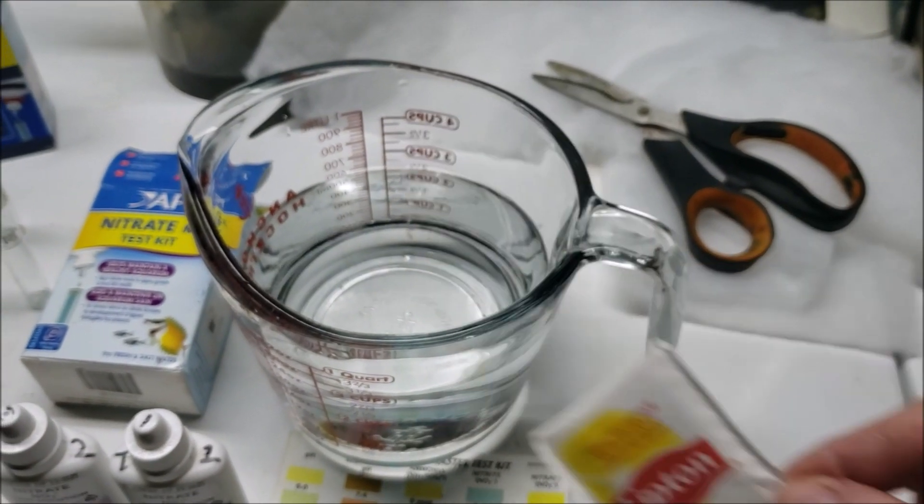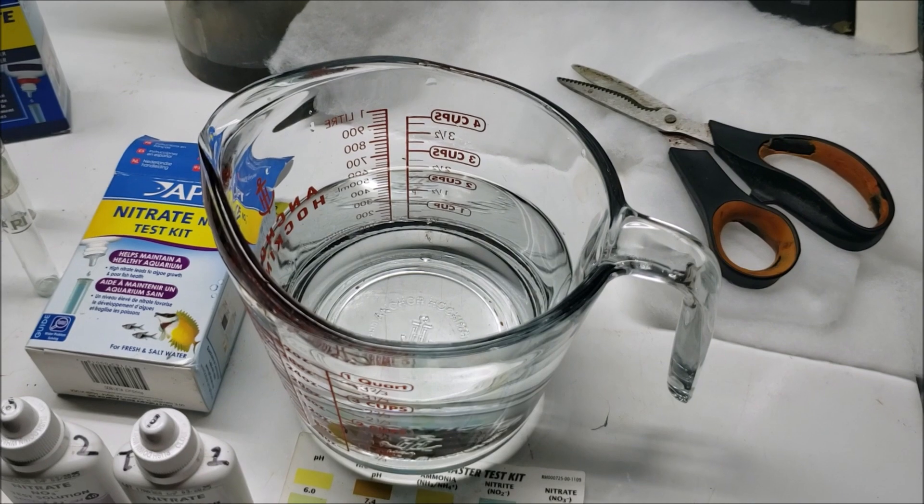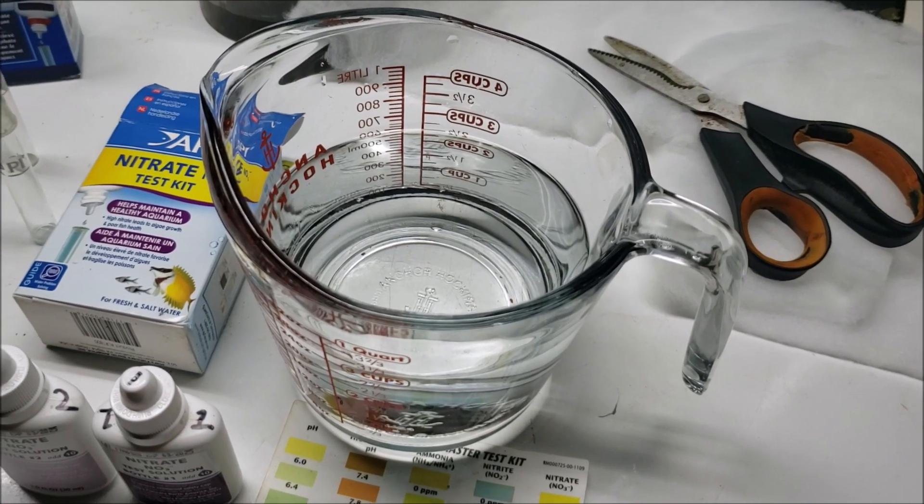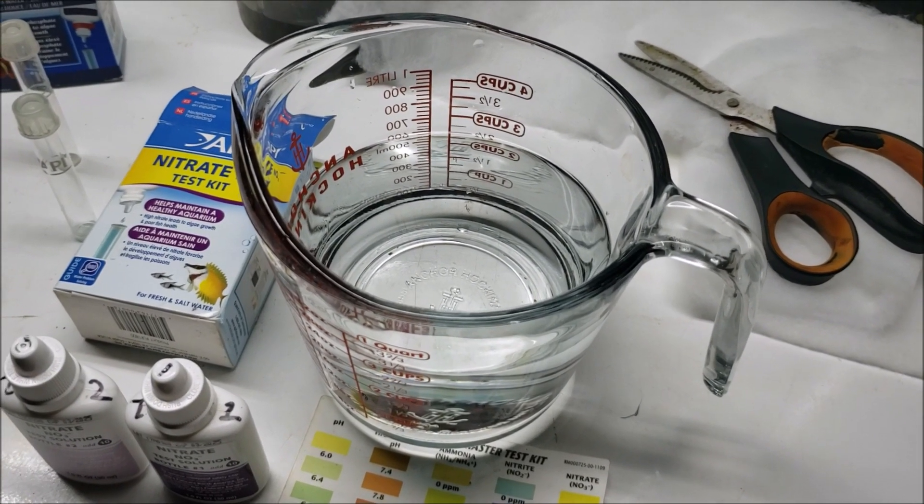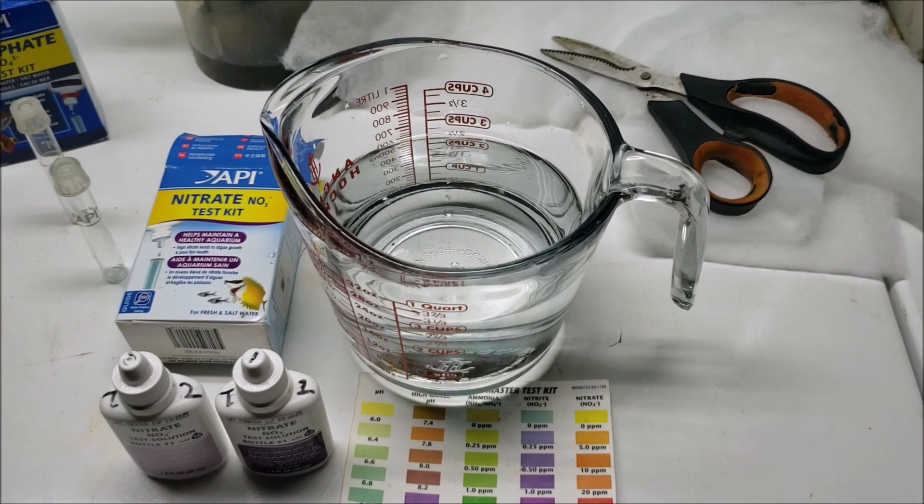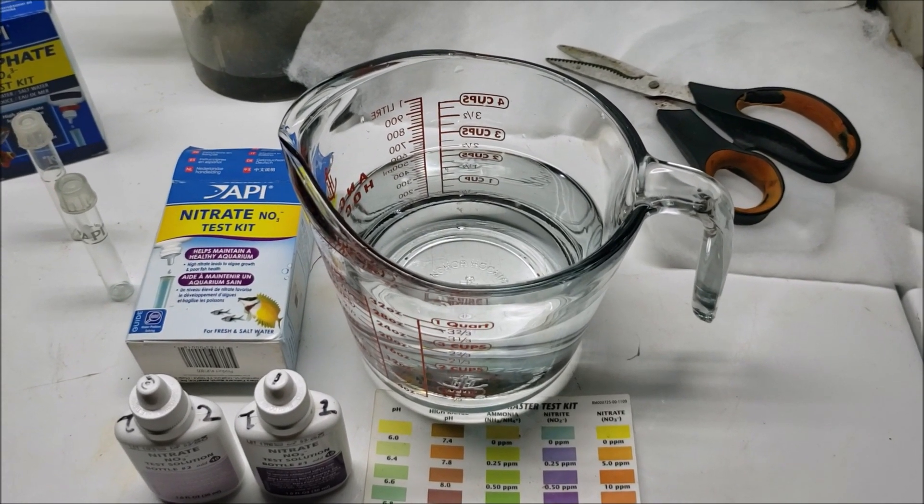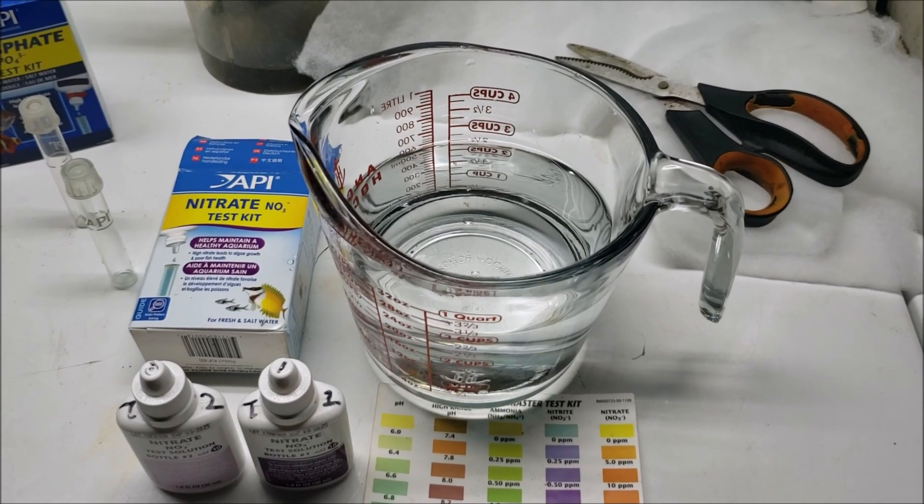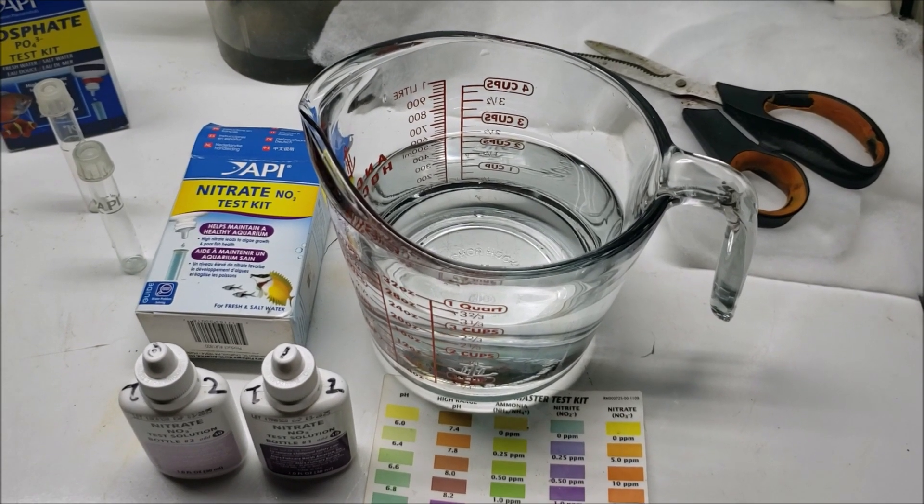Courtesy of Lipton tea. And knowing that that will not add any nitrate, it will only add some tannin to the water, we'll test it again and we'll be able to compare the two vials and see if there's an actual color difference based on the stained water, not the amount of nitrate.